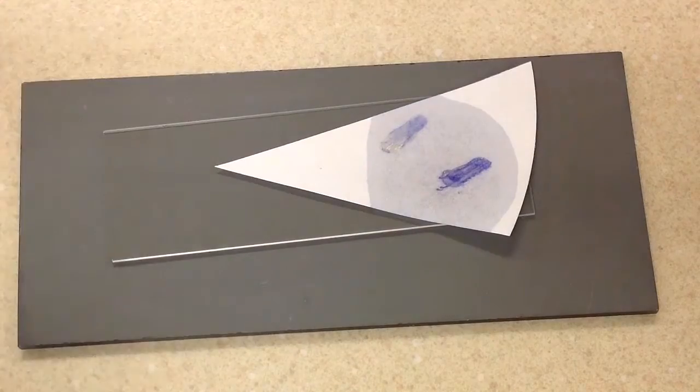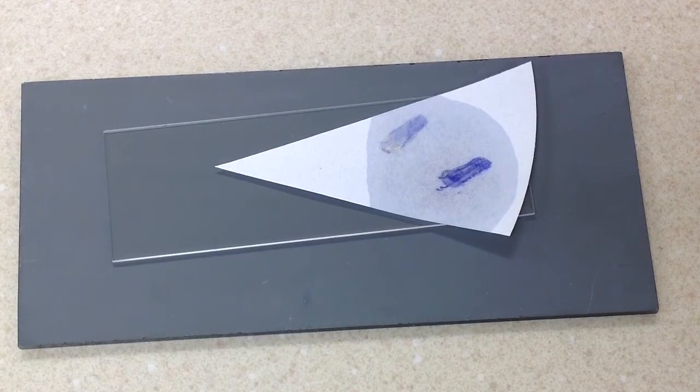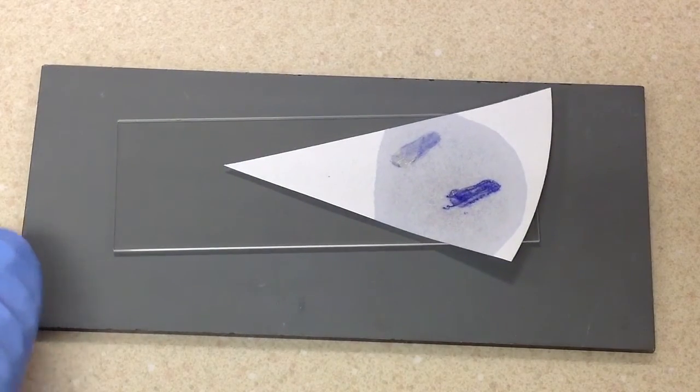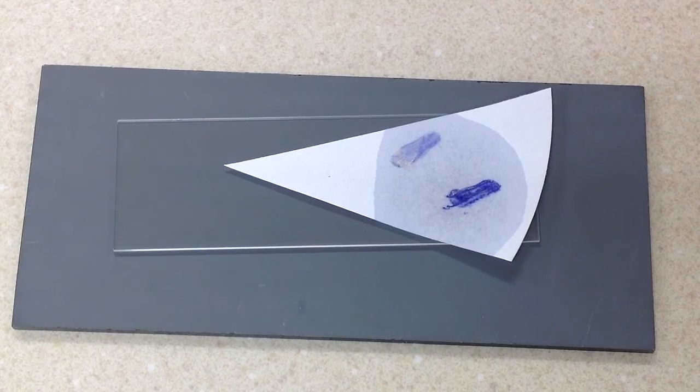the Klebsiella, you can see how as I let it sit longer on there, it does eventually turn blue. And so that's why it's important to make the decision about whether it's positive or negative within that 20-second time frame.